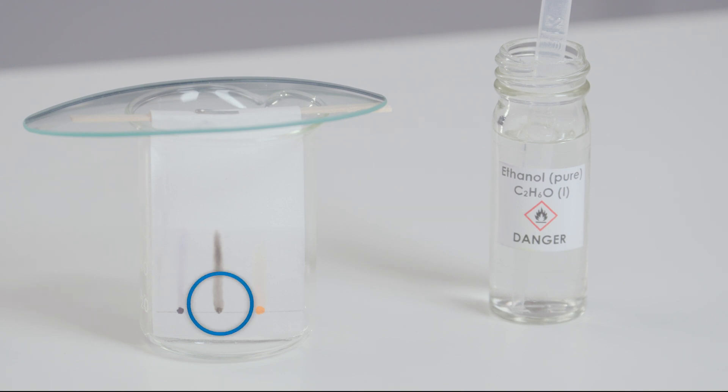You can see from these results that sample two is soluble in ethanol and contains only black ink.